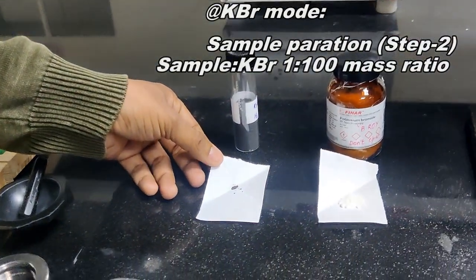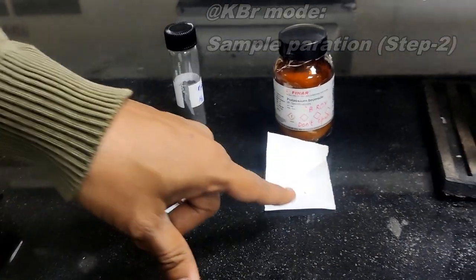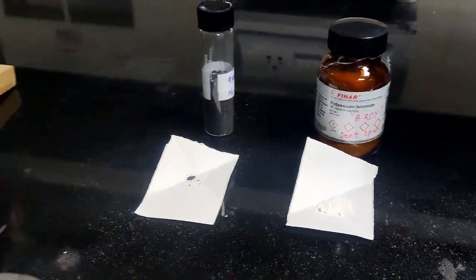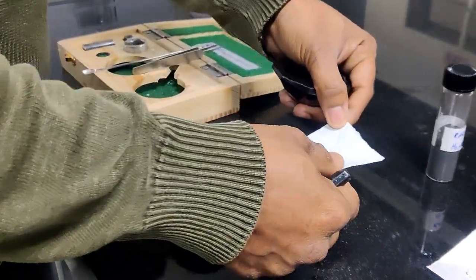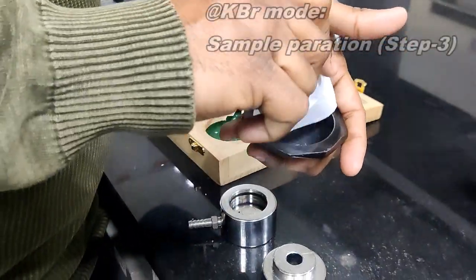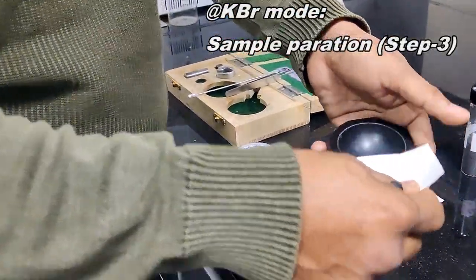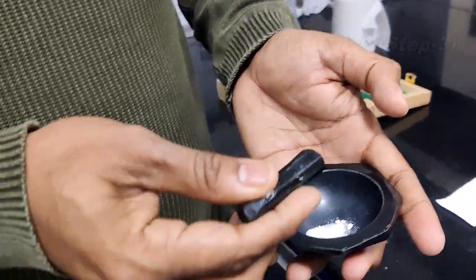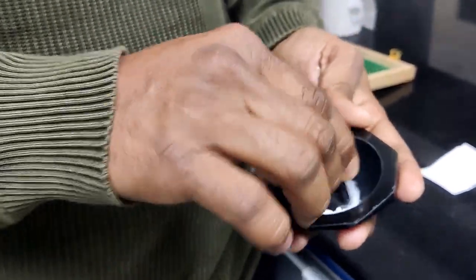Now I have taken this sample, 2 milligrams. With respect to that mass, for the 1:100 ratio, I have measured the KBr also with the help of a microbalance. After that, we need to take the sample and KBr into the mortar. I have taken the sample and KBr into the mortar with the help of a pestle. I am making this a fine powder, so we have to grind like this.